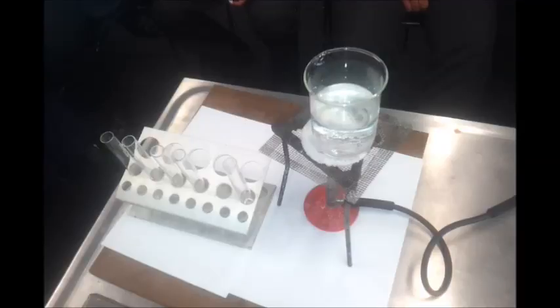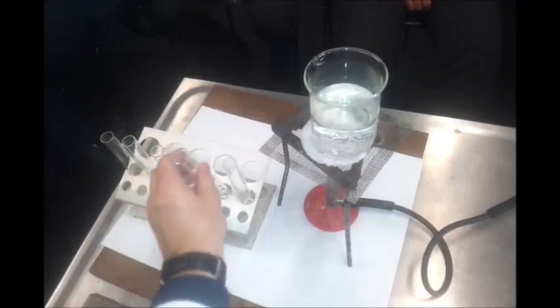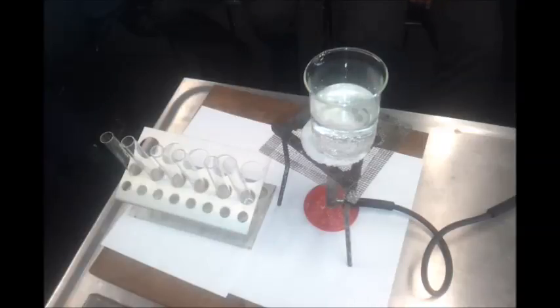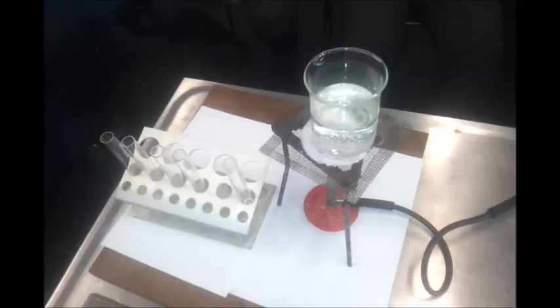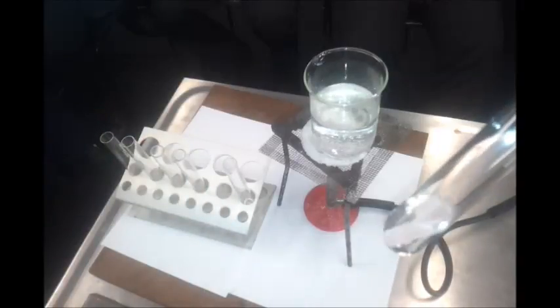Right, sticking with our ethanol, another thing that we can look at is whether it's got a pH. It's got an OH at the end of it, so what would we predict is its pH? Alkaline or acidic? Alkaline. Okay, let's have a look. So if we think it's alkaline, I use red litmus paper and expect that red litmus paper to turn blue. Okay, so let's see if that is indeed the case. Okay, and we can see that it stays red.